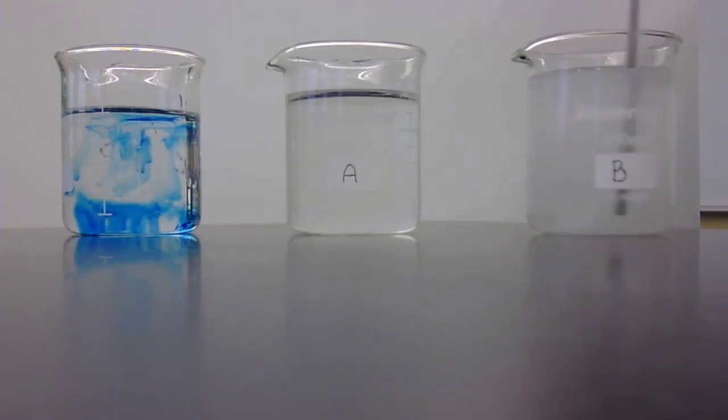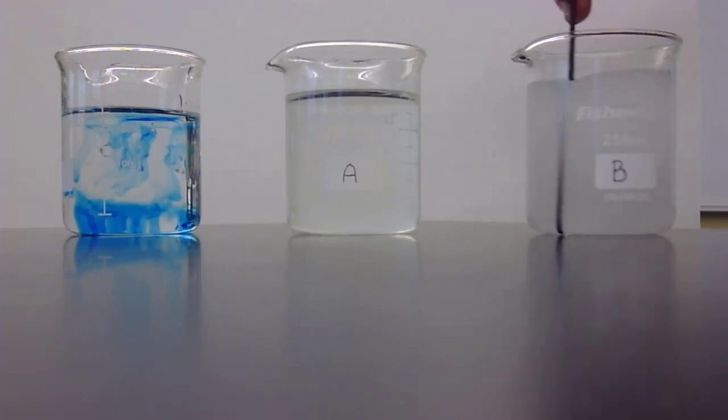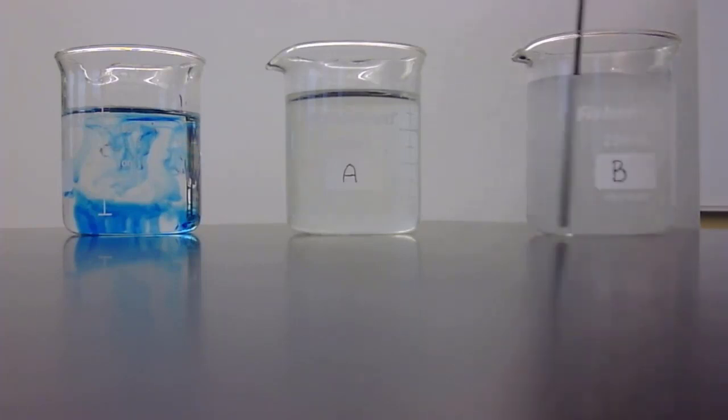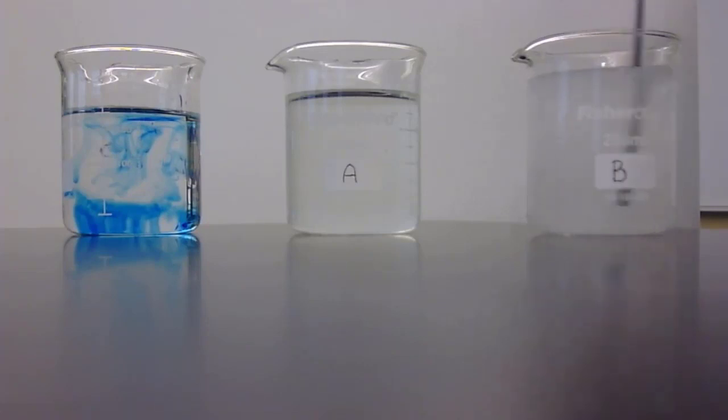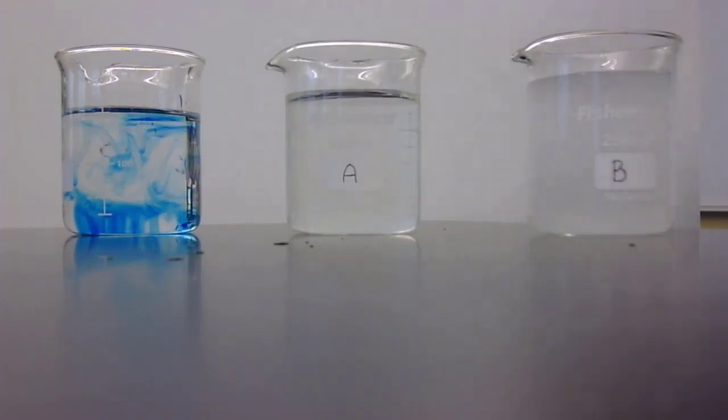The way that we're going to be able to tell if there has been any change over time, if there's been any movement of water either in or out of the potato chunk, is by taking its weight. As if it has gained water, it will gain weight. If it loses water, it will lose weight. And I think that that is probably as well distributed as we can get. You can see that the water is very murky, cloudy, with the amount of salt that's located in it.